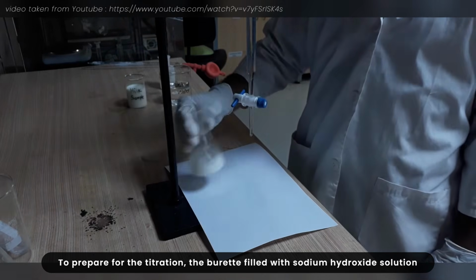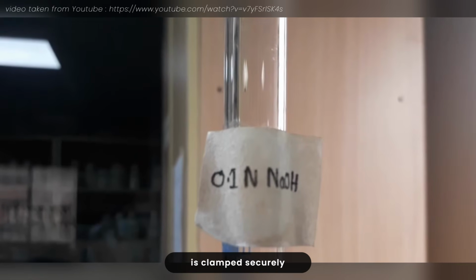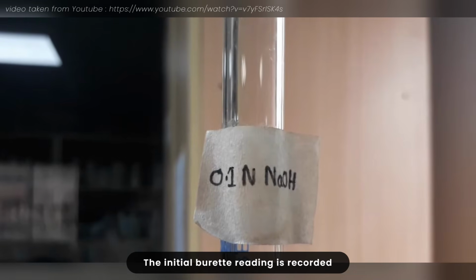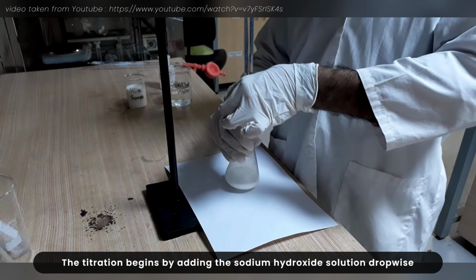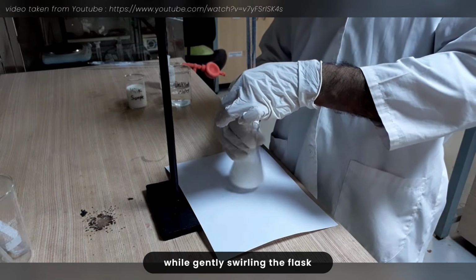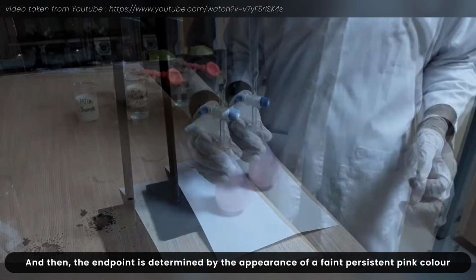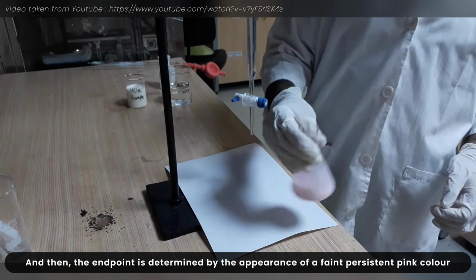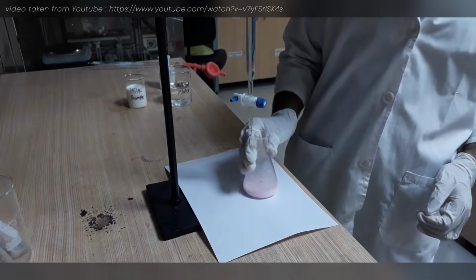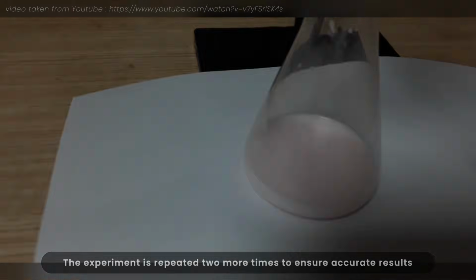To prepare for the titration, the burette filled with sodium hydroxide solution is clamped securely and the conical flask is placed beneath the burette. The initial burette reading is recorded. The titration begins by adding the sodium hydroxide solution dropwise while gently swirling the flask. And then, the end point is determined by the appearance of a faint, persistent pink color. Finally, we record the final burette reading. The experiment is repeated 2 more times to ensure an accurate result.